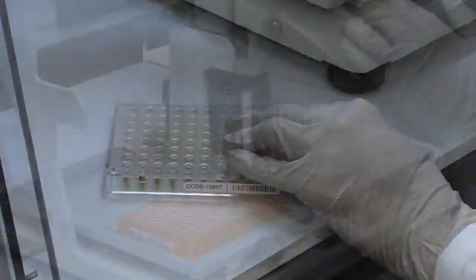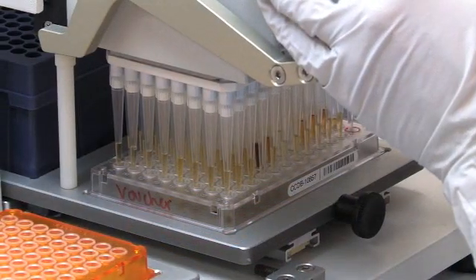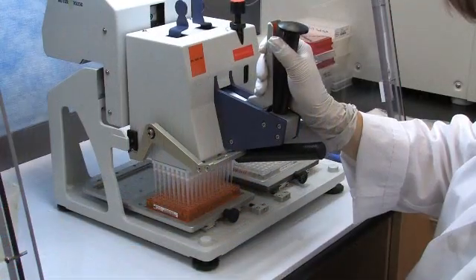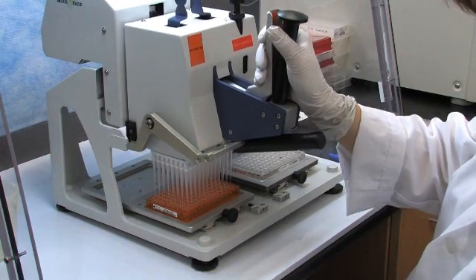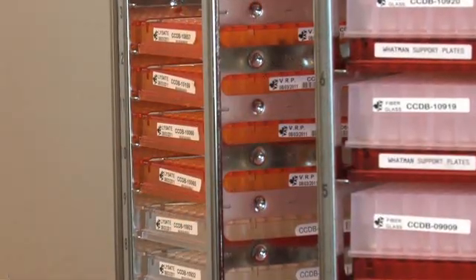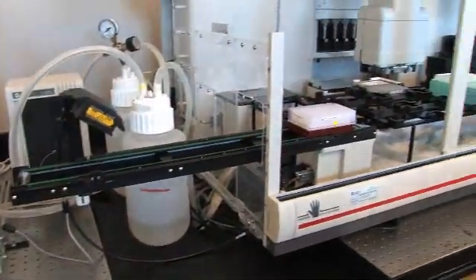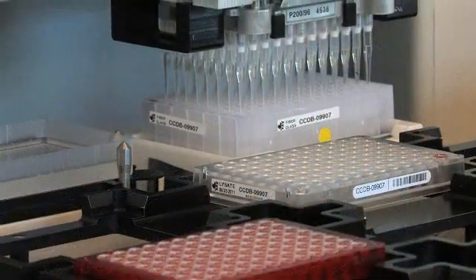When the amount of tissue exceeds the CCDB's standard, more lysis buffer is added to the sample. 50 microliters of lysate are transferred to a clean microplate for DNA extraction using the liquidator 96. The plates are then placed on the Cytomat Hotel, which delivers them to the robotic deck for further processing.